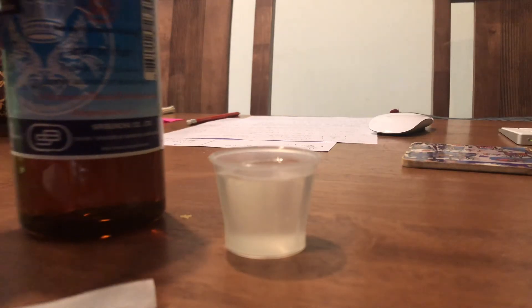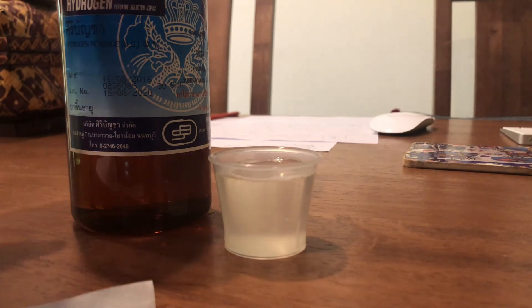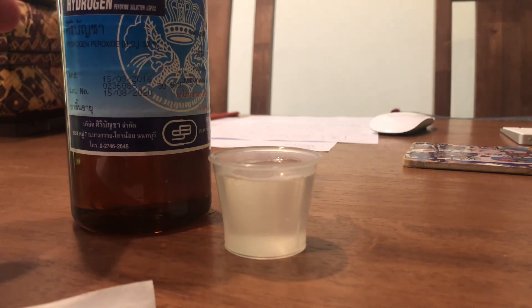This is approximately 3% hydrogen peroxide — that's what medical hydrogen peroxide is, and that's going to be our strongest solution. You're going to repeat what I just did ten times, so you'll have ten trials, and you're going to record the time it takes for the filter disk to sink to the bottom and then come back up to the top.